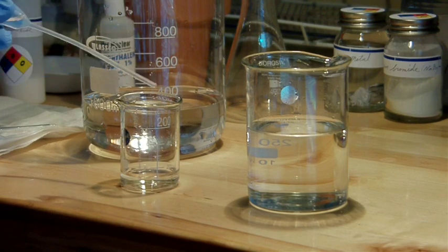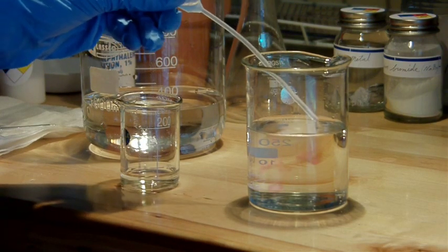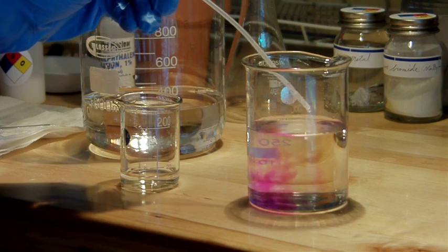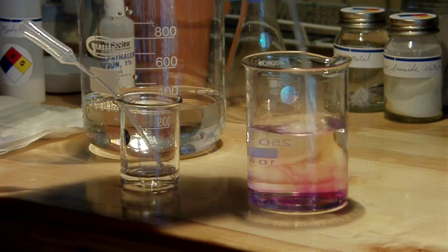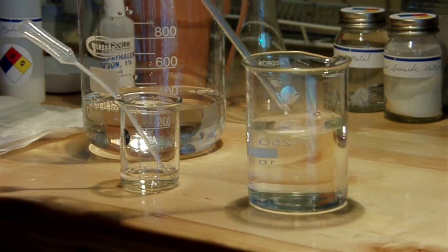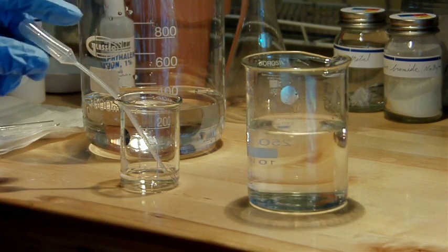So we're very close to the end now, and this is the point where it starts to get a little frustrating. Because once you think it's done, just a quick stir, and the color disappears again. And you have to keep on going.